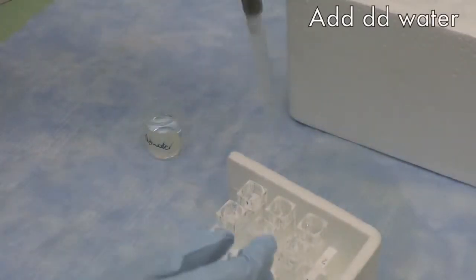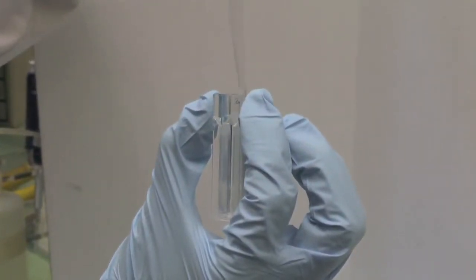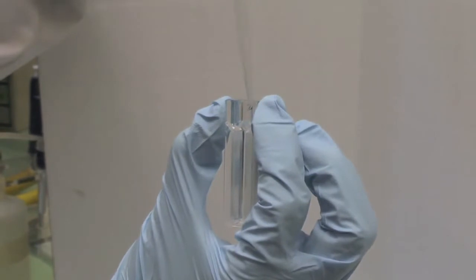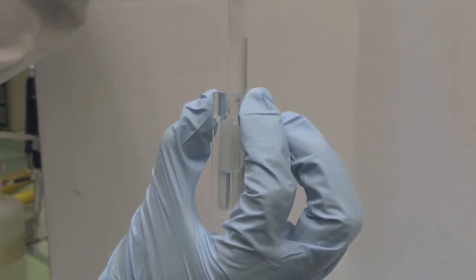Remember to prepare your sample blanks. Use the pipet man to mix the solution by pipetting up and down, then switch to a new pipet tip for the next cuvette.